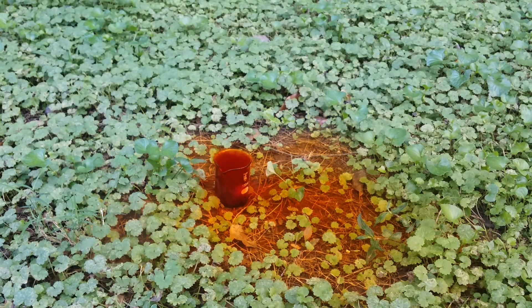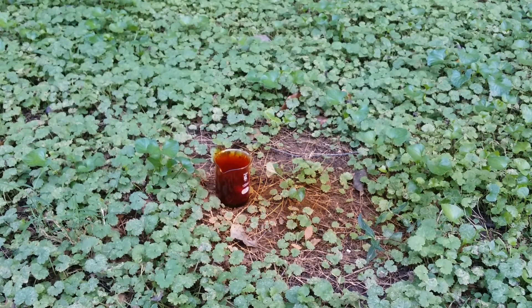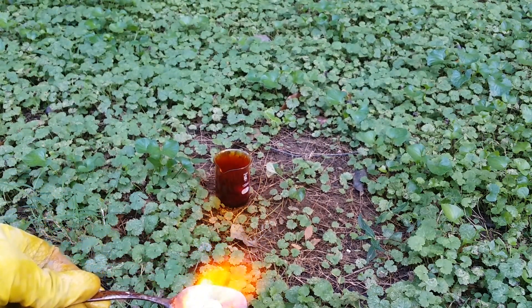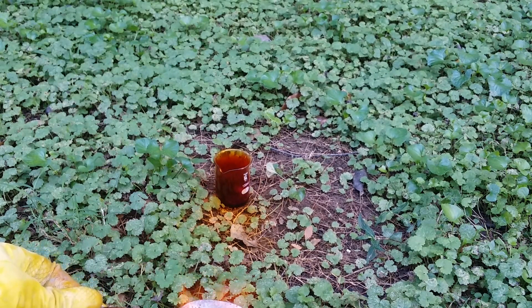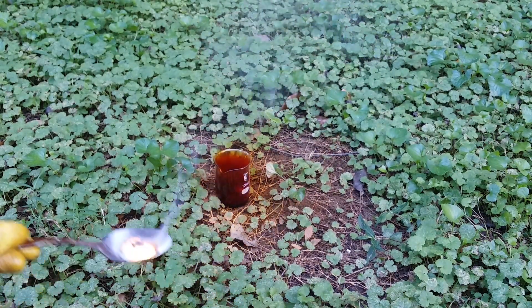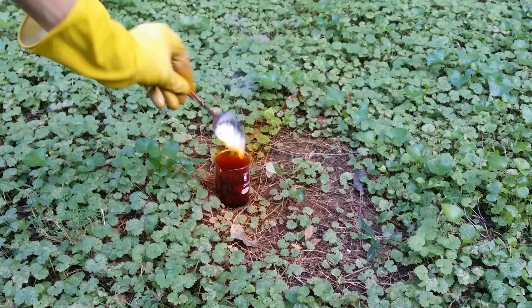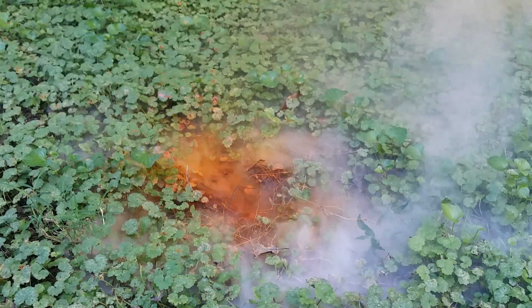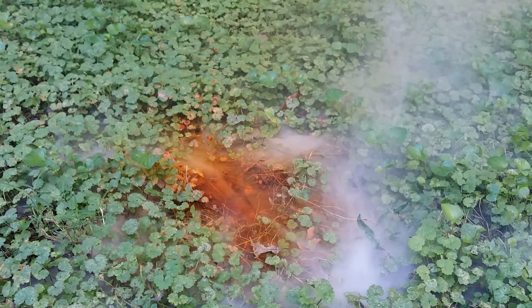Let's start heating it until it melts and starts burning. Liquid sodium and bromine in three, two, one. That was crazy. Good thing I was wearing my face shield for that one.